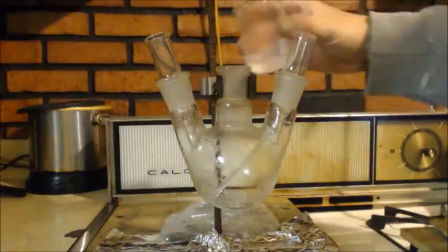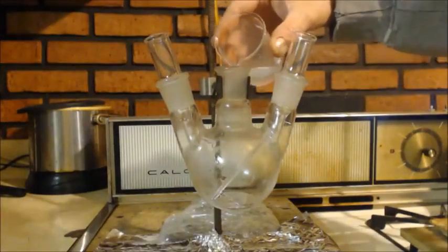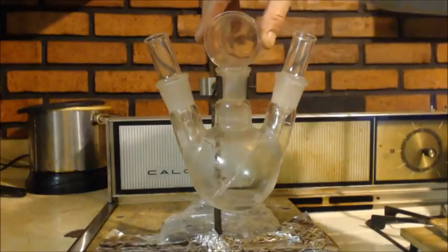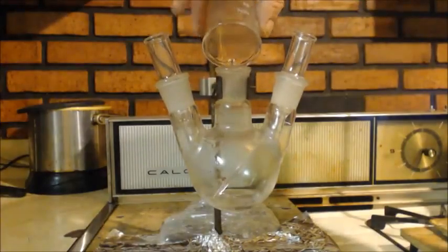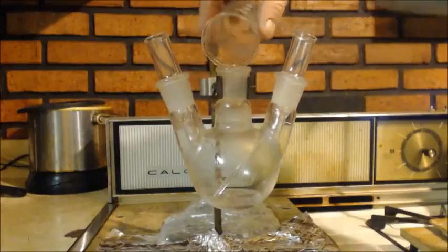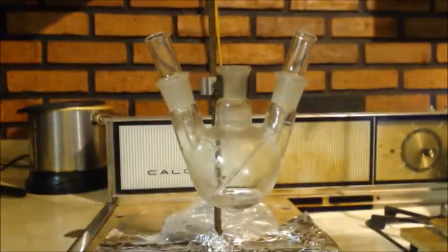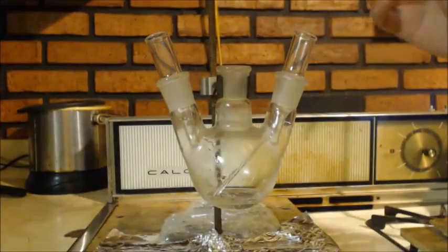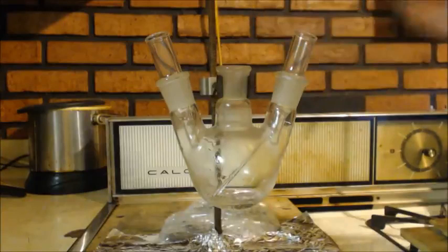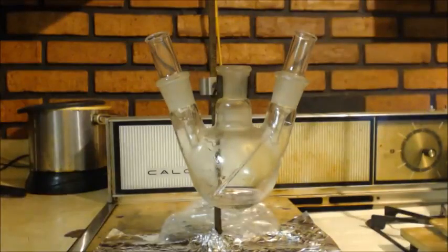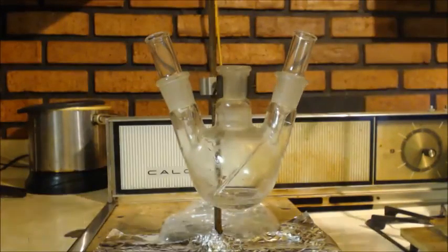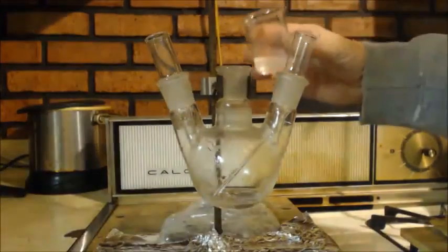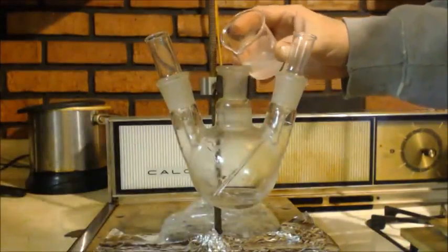I don't know if you can tell or not, but everything's been put in the freezer. Now I'm adding the rubbing alcohol, but this is anhydrous, there's no water in it. And this sulfuric acid is anhydrous and it's concentrated. I distilled this, you can't get better sulfuric acid than this. Or actually, crap, that is wrong, wrong sulfuric acid. Oh well, too late now. But it has been boiled.